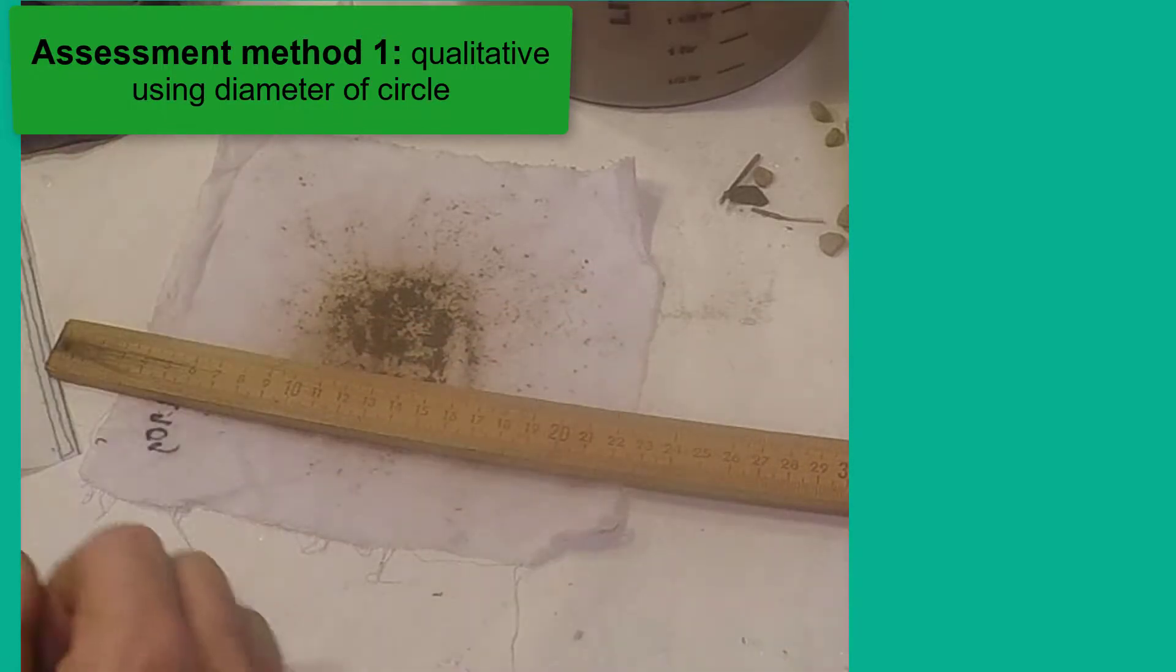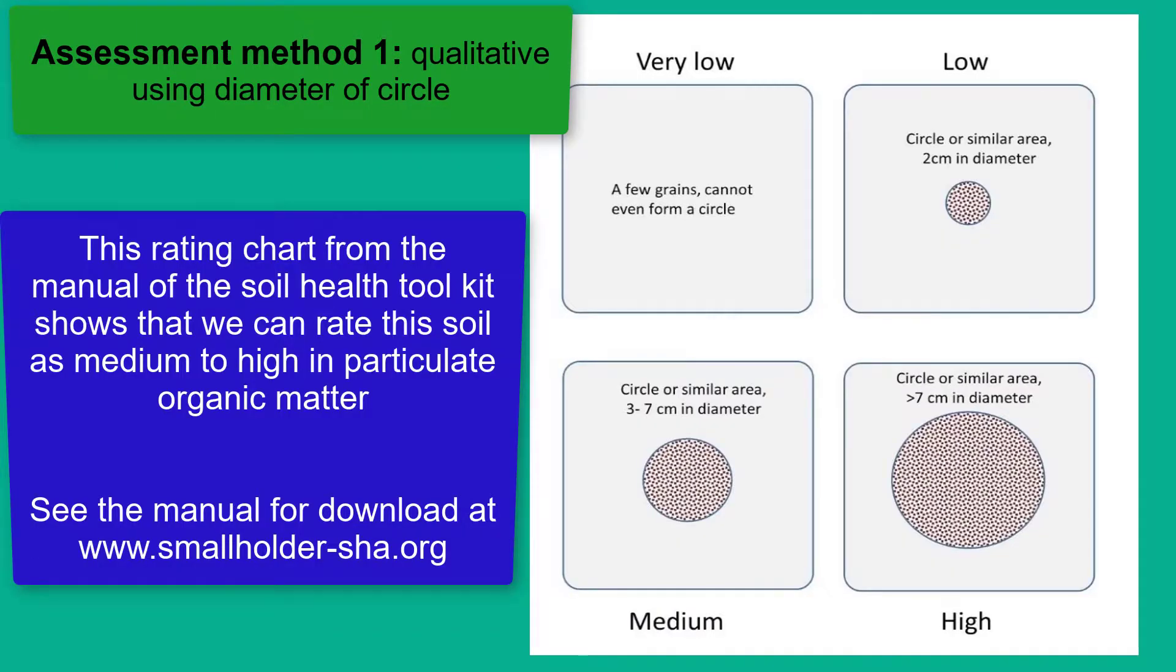This diameter measurement is compared to a rating chart like the one shown from the toolkit manual we have prepared, which is based on experience with a range of soils that have different POM contents.